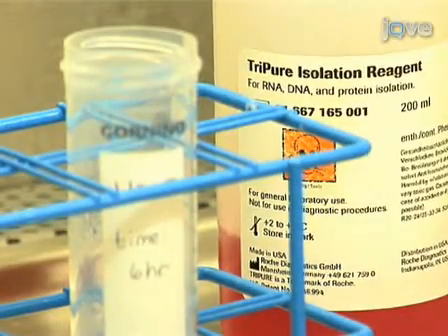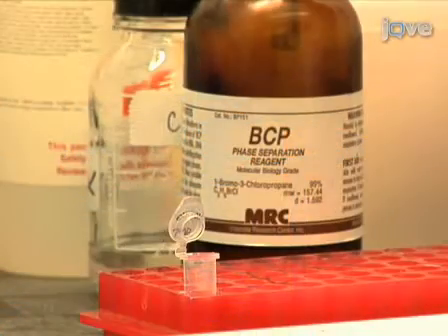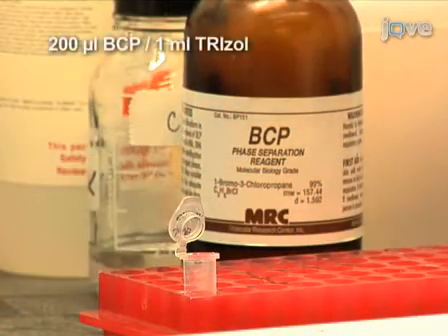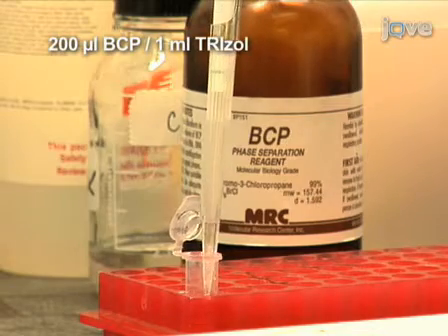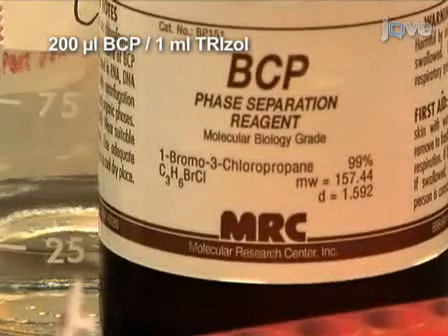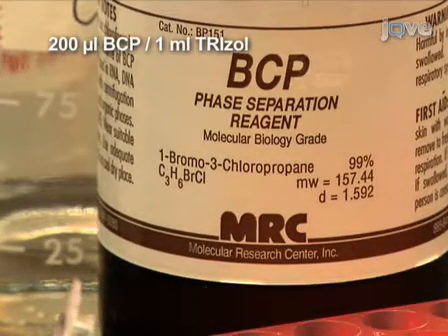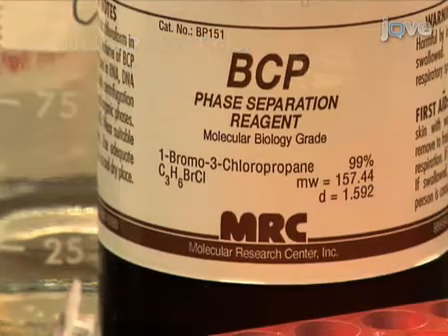At this point, your sample should be resuspended in trizol reagent and ready to be processed. Add 200 microliters of the BCP phase separation reagent for every 1 milliliter of trizol in each tube. BCP, or 1-bromo-3-chloropropane, is used in place of phenol to reduce genomic DNA contamination.